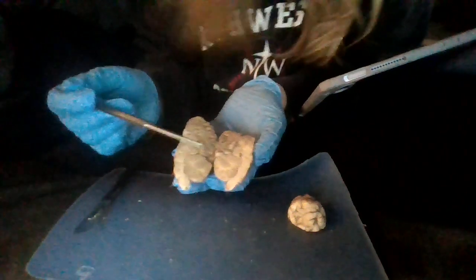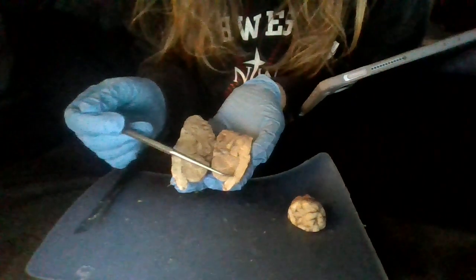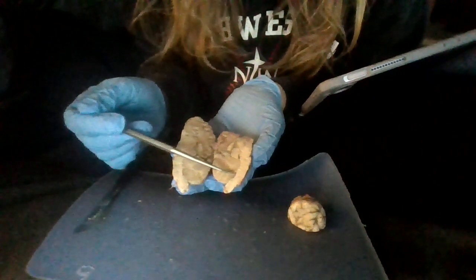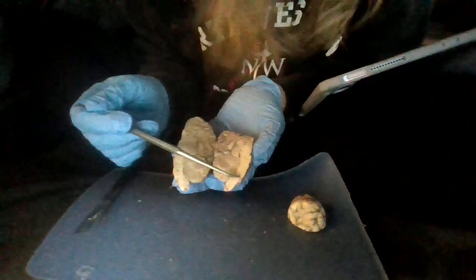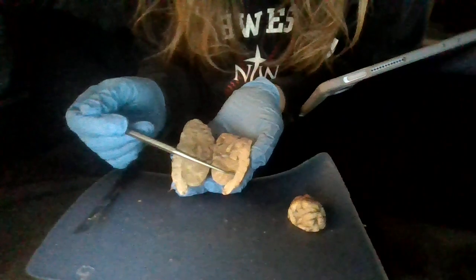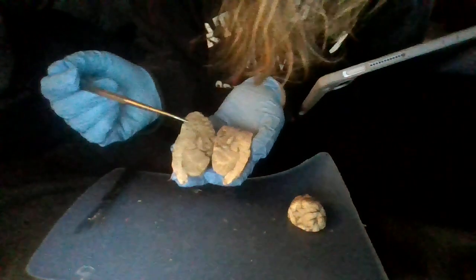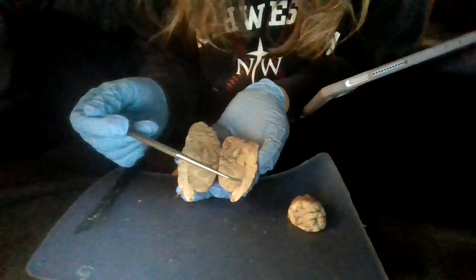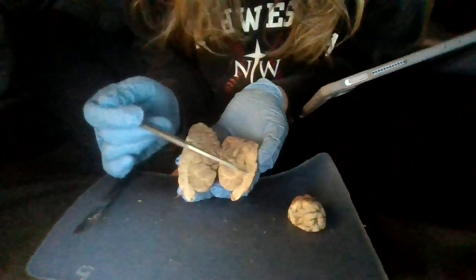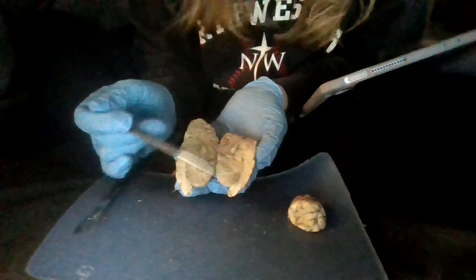And then we're going to have our fourth ventricle, which is going to be right in here, right between the cerebellum and our medulla, I believe it's called. The fourth ventricle is going to be right there. And then we have this, and don't correct me if I'm wrong, I might be wrong, but the medulla is going to be like the lower portion of this piece here.